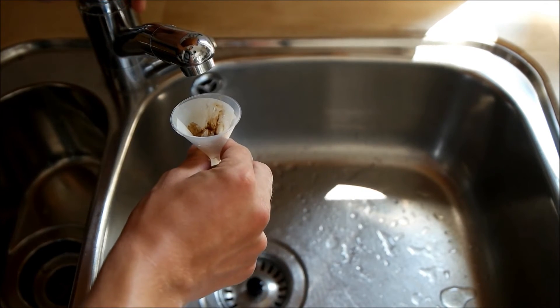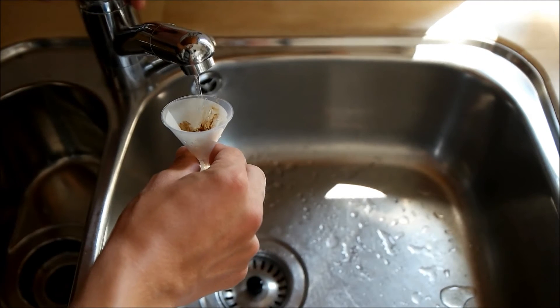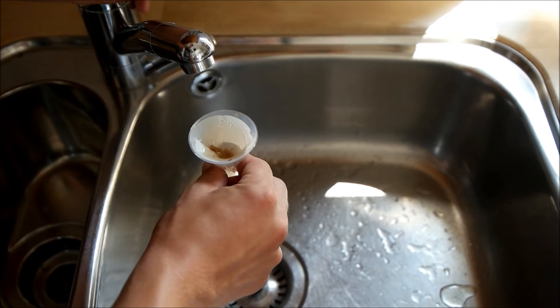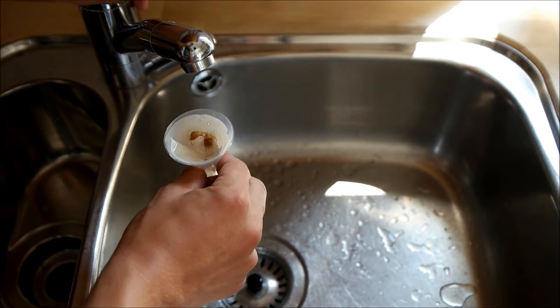Now it's important to wash the bacteria so that they aren't acidic anymore, because otherwise the agar plate would immediately indicate acid. So I'll just wash it a few times, and then we can go on.